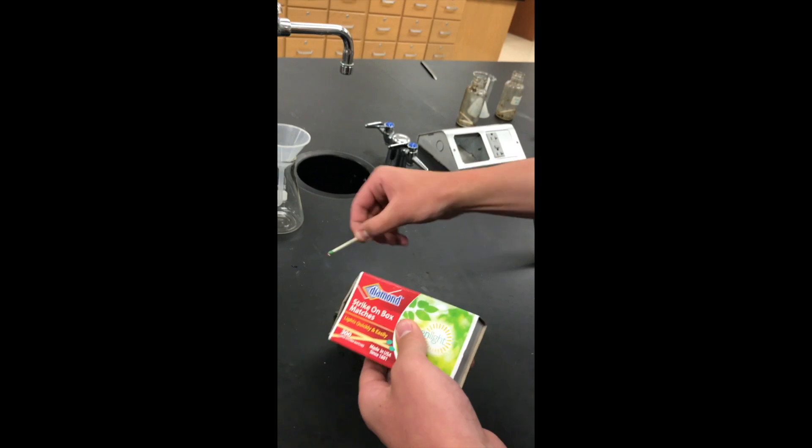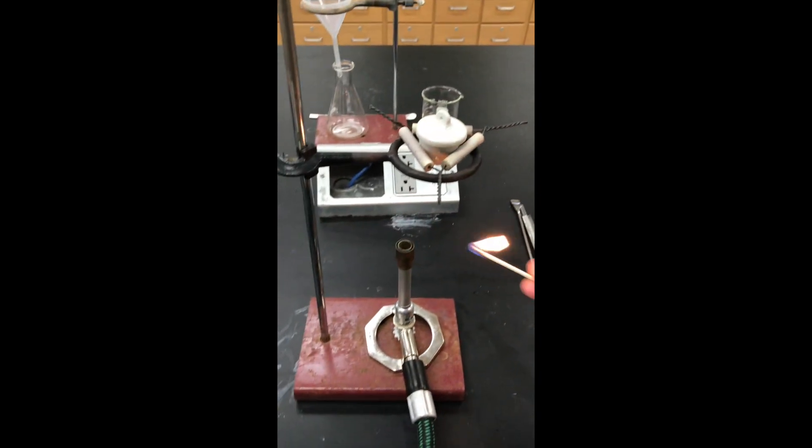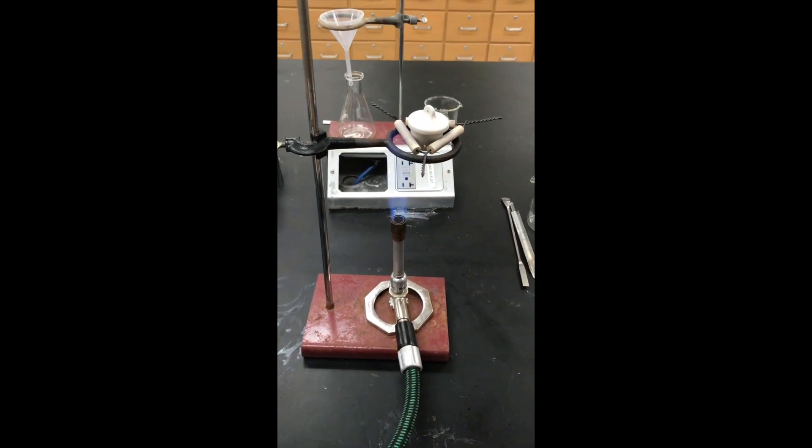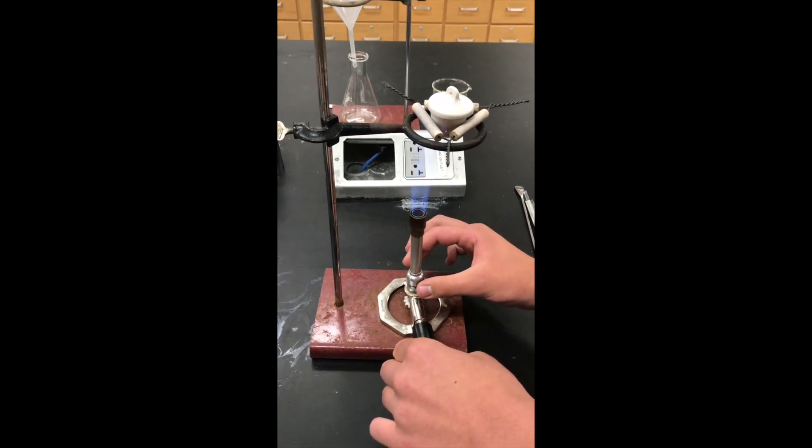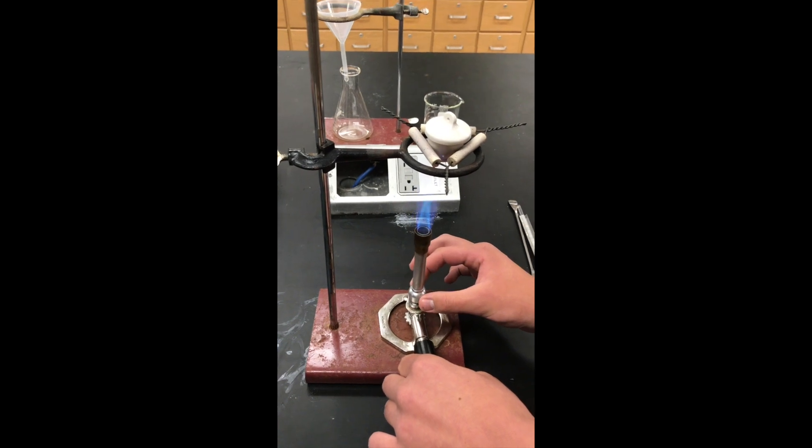And you will light a match. Make sure it's lit. You approach the top and the flame is lit. You can adjust oxygen levels by twisting the Bunsen burner to give you more or less oxygen how you desire.